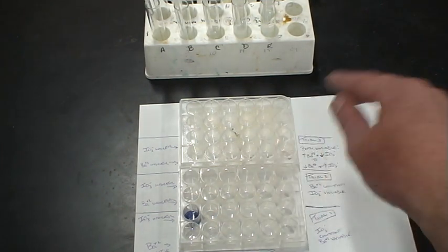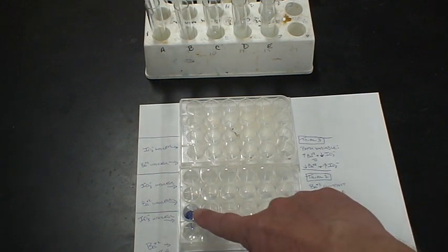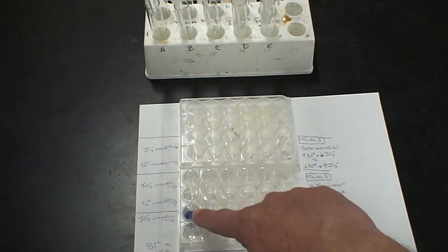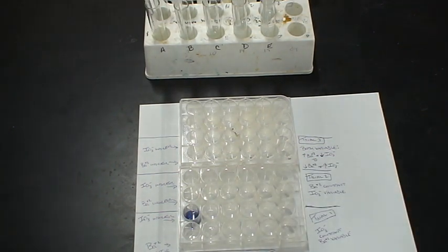It's the same procedure we did. I'll load up the other wells and I'll get you a picture of that. Then we'll run through how to do the math to adjust and figure out how much precipitate was actually formed. The grand reveal of all of this is how much excess remains. If we say we have excess of this left over, the question is how much did we add? How much excess remains after the reaction?